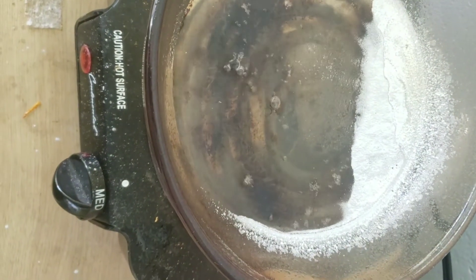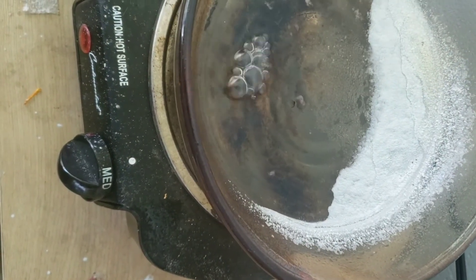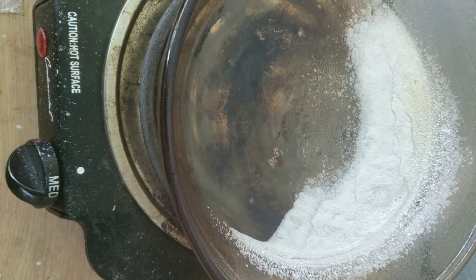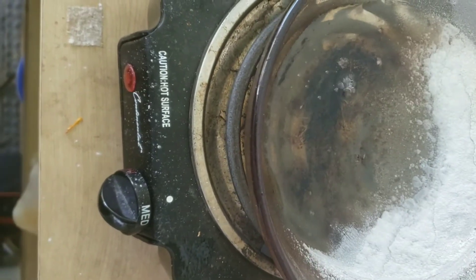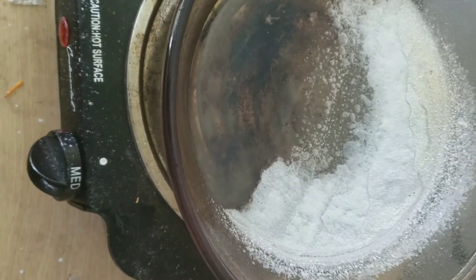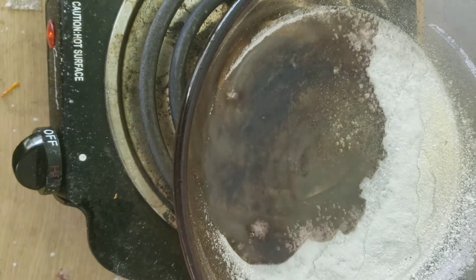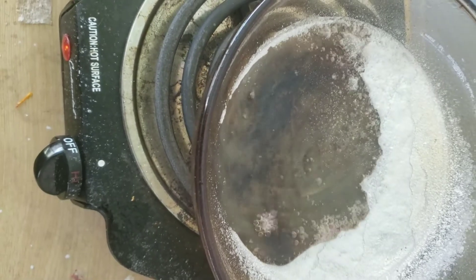On the third attempt, you can see the white crystals begin to form slowly as the vinegar evaporates — they're just slowly forming. The struggle was to keep it from burning or turning brown. I don't think it's a big deal if it turns brown, I just didn't want it to burn, so I was trying to hold the dish in a certain way so that the part that had already crystallized wouldn't still be directly on the heat.